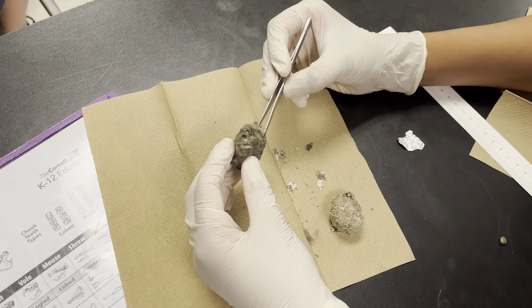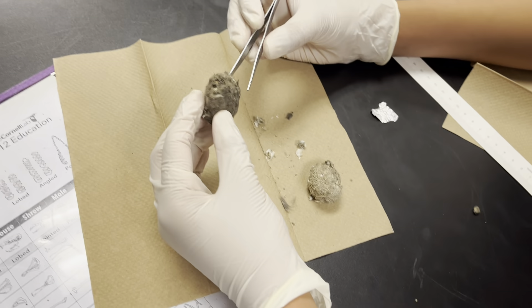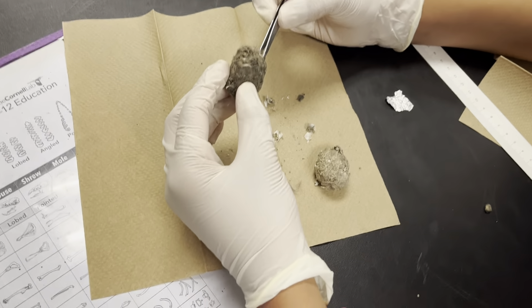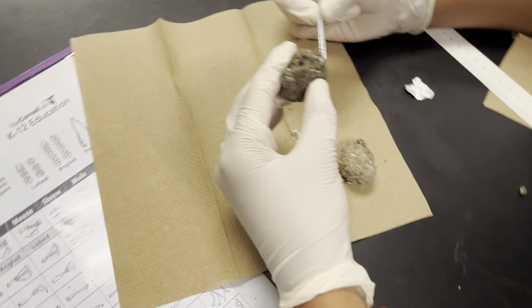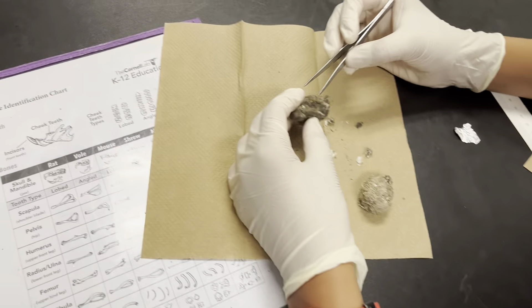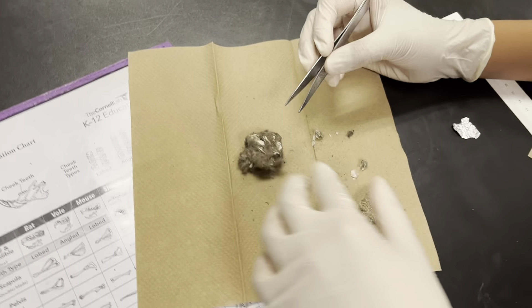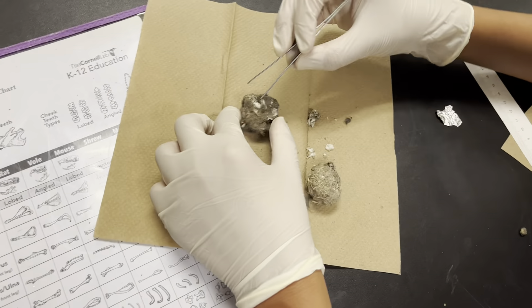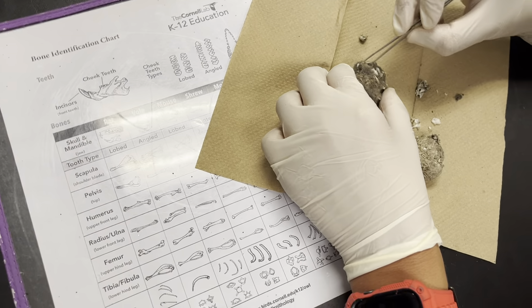Take it out. You're in science right now. This is hard. Get a straw — you can do it with a straw, it would be a lot easier. There are no straws here. Is this going to be a bust, guys? Hit me down in the comments below.